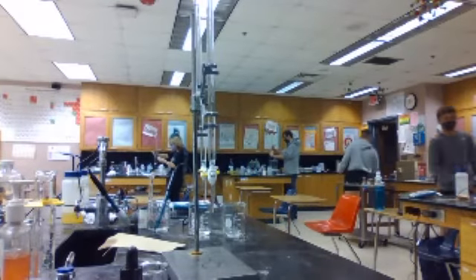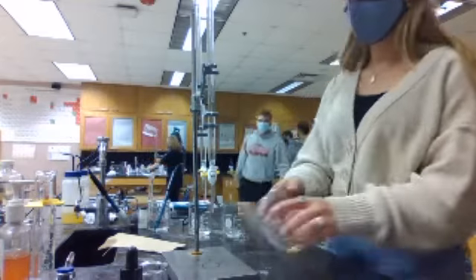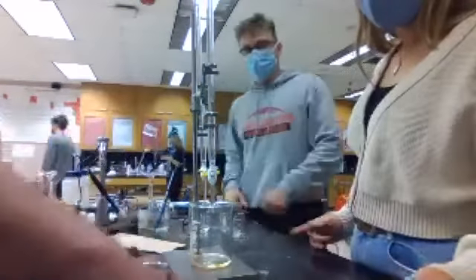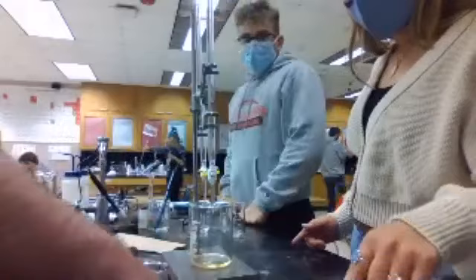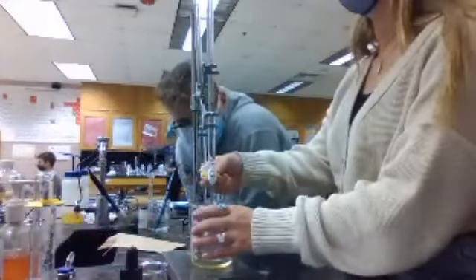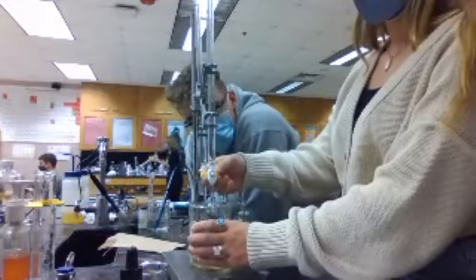How many milliliters do you put in there? I put in, see the initial. It's going to take at least nine. So let's keep going. It's supposed to be around 15.67, and right now it's at 15.6. Probably not. Okay. Yeah, let's keep going.